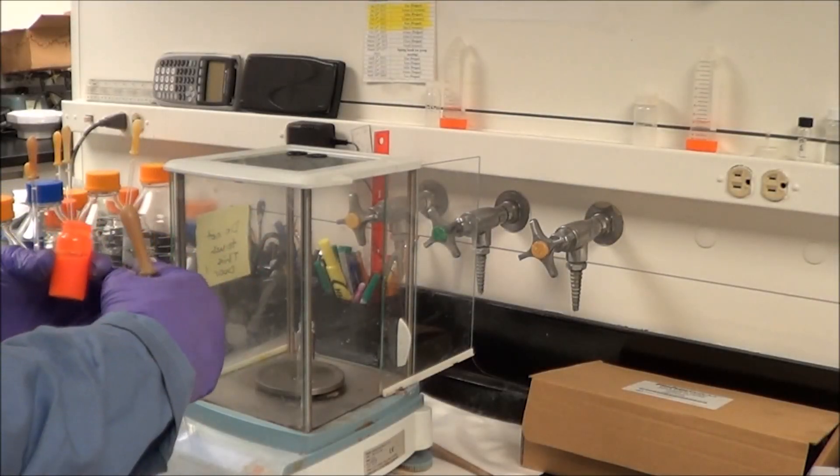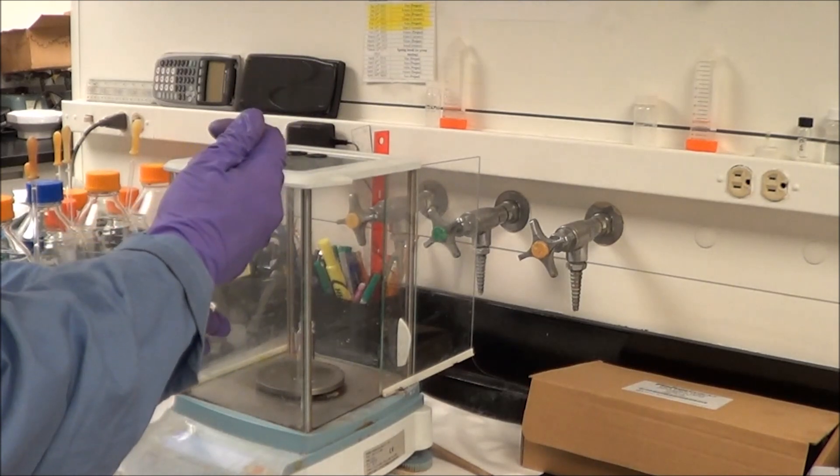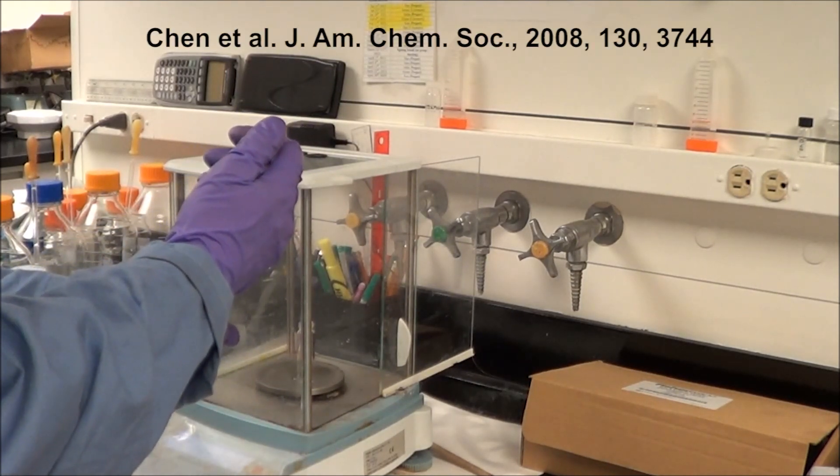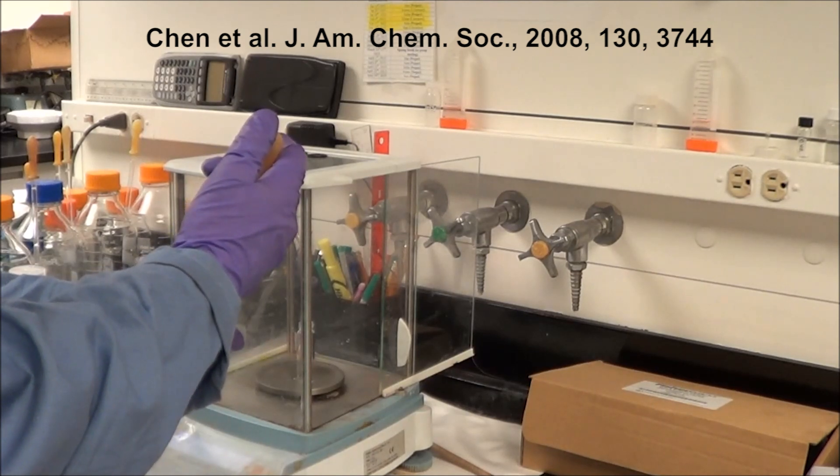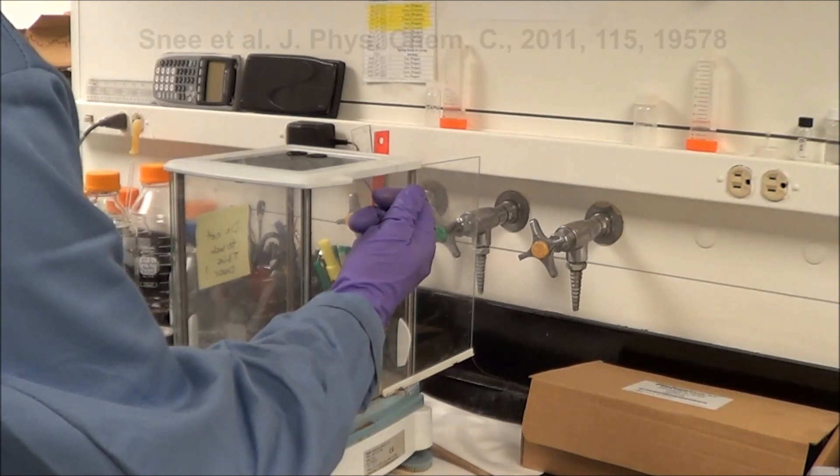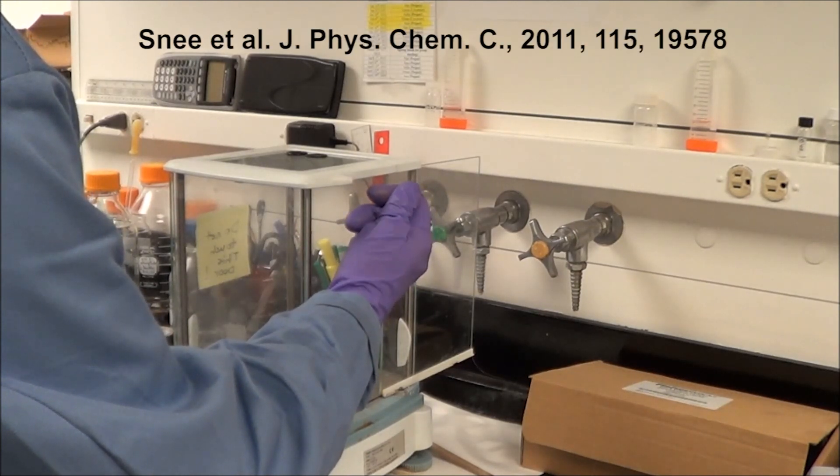For this video we're going to water solubilize some quantum dots using amphiphilic polymers according to the reference shown above, but since this is a video tutorial we're going to get into a lot more detail.